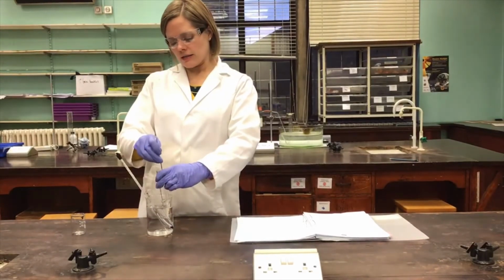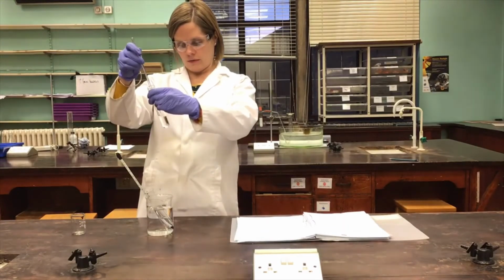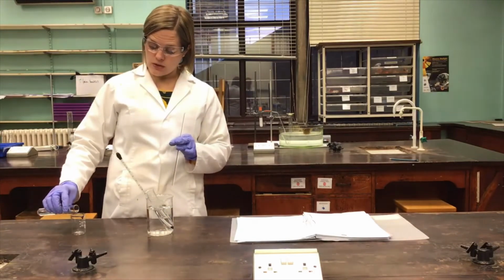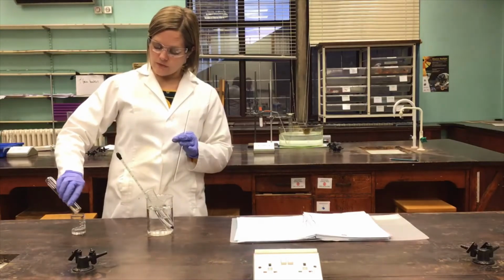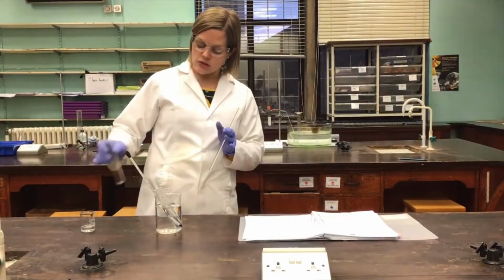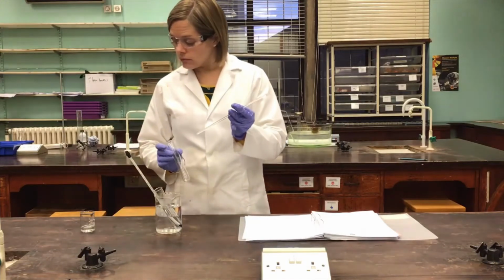So it's looking as if that ethanol has caused the aspirin to dissolve quite nicely. So the next thing we're going to do is simply pour it into a small cold beaker, just like that. So I've dissolved the aspirin in the minimum volume of the hot solvent, and then taken it out of the water bath and put it onto a cold surface, a nice cold beaker in this case.